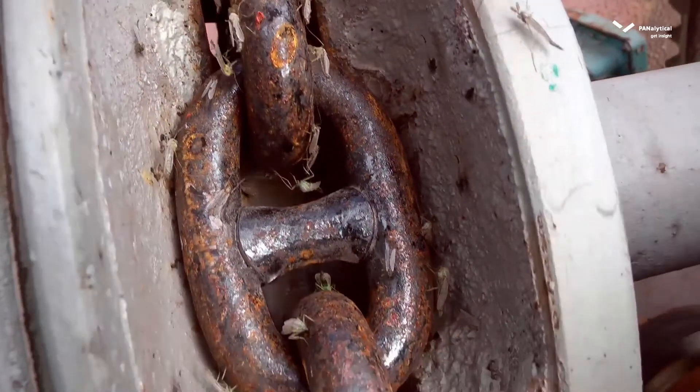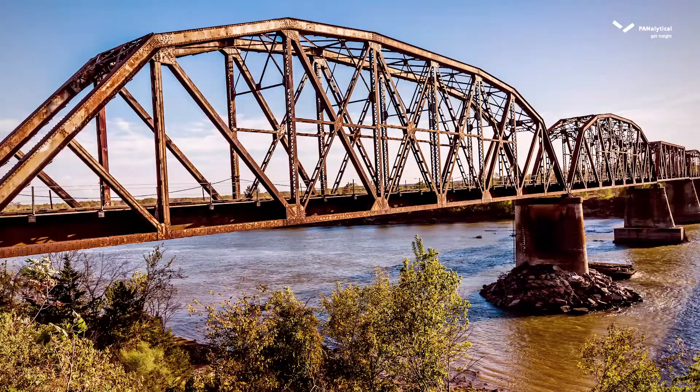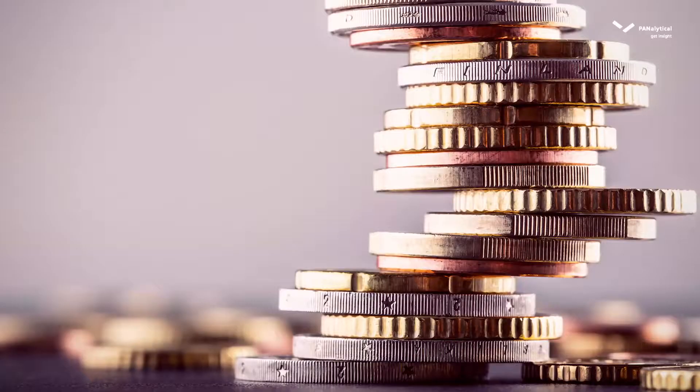With the help of X-ray fluorescence, we analyze the elements that are present in materials. Take as an example iron — nowadays there are hundreds of different types of steel.